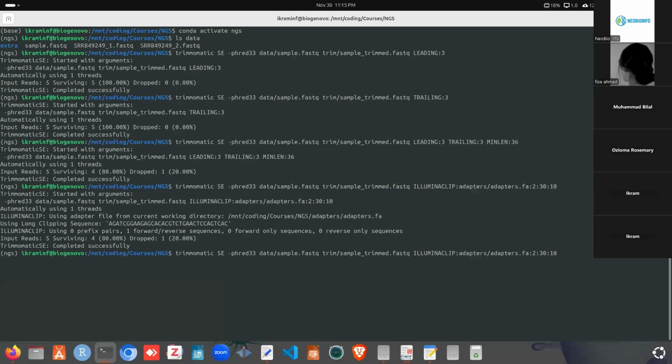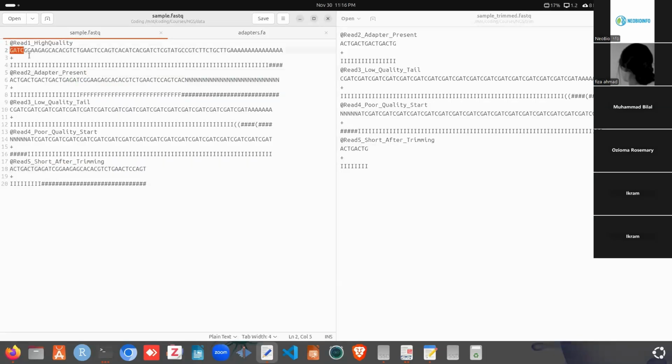So after removing the adapter sequence, we can check the sliding window. The sliding window works like this: the first parameter, that is the 4, is the number of bases the sliding window will consider each time. And the 20 here is the quality, the average quality. So if we look at the original sequence in here, we specified 4, so it will take these 4 bases at first, then it will sum up all of these, that is 40, 40, 40, 40. So all the quality scores for the 4 bases sum to 160, then we need to take the average: 160 divided by 4 is 40, and 40 is greater than 20, that is our threshold 20, so it's fine. And after that, it will go on like that, 4 bases, then the next 4 bases, something like this.